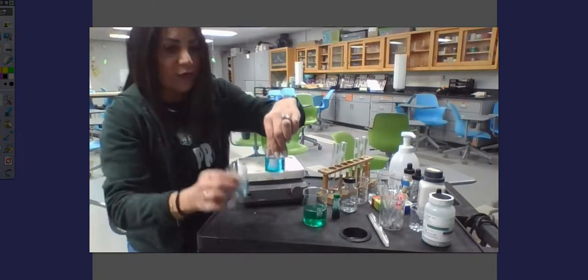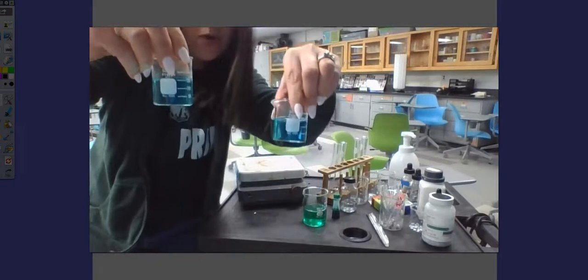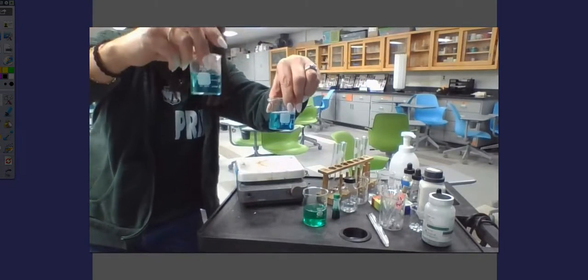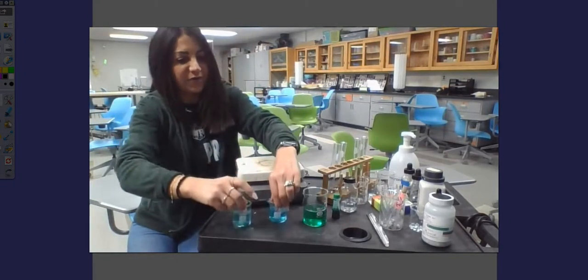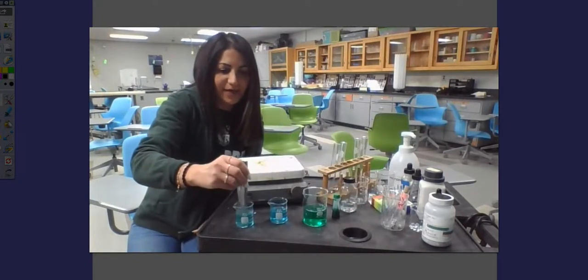What I want you to notice here is the hot one already should be looking a little bit lighter than the cold one. So let's just see what happens here. I'm going to give both of them just a little bit of a stir, and let's take a look and see what happens.